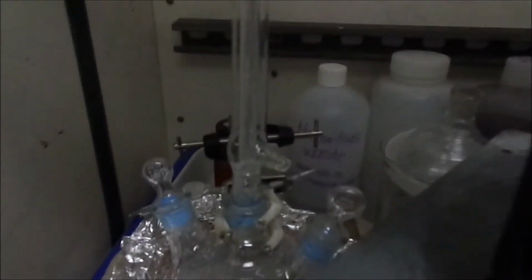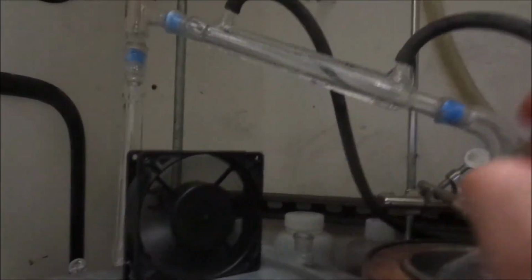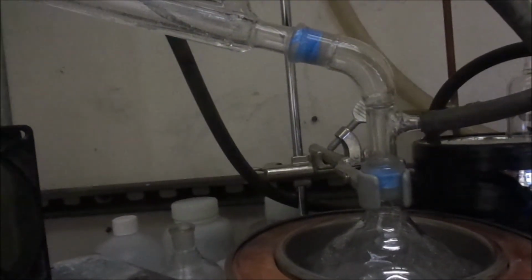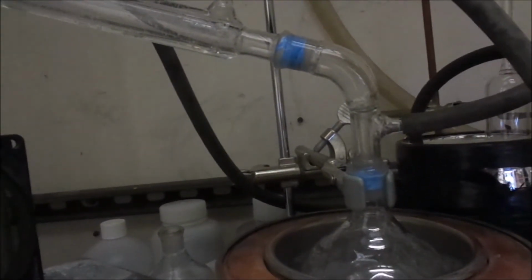So same setup that we did before. The big difference is, of course, we have our tower on here. This is our second distillation. We need really pure mercury for the next part of this project. So it's going to be a late night tonight, but that's okay. I have no kids today, so I plan on this being a late night. So I'm going to stick it out with this until it's done.